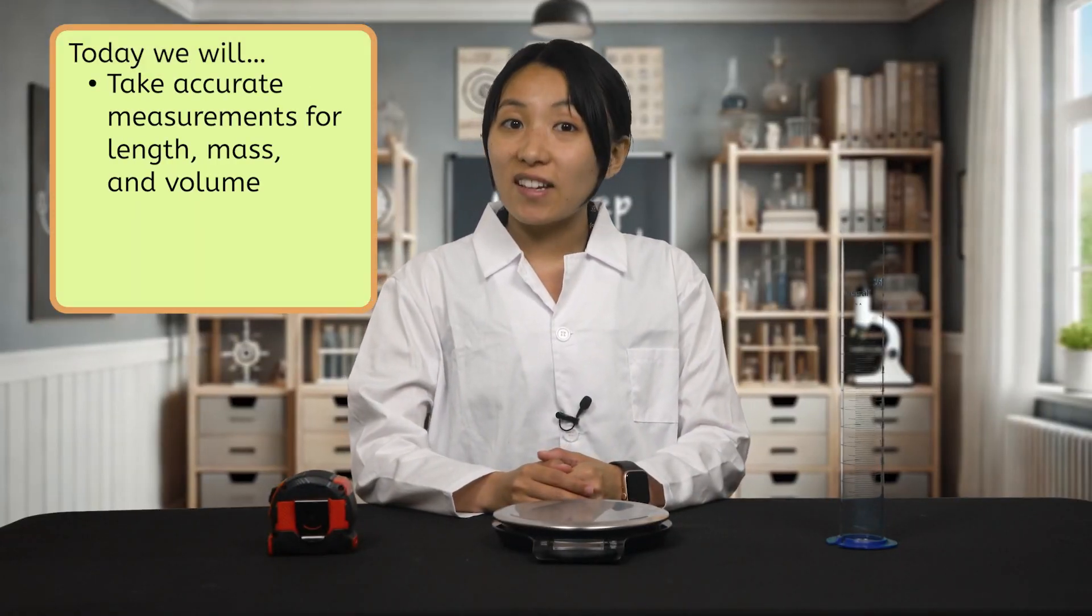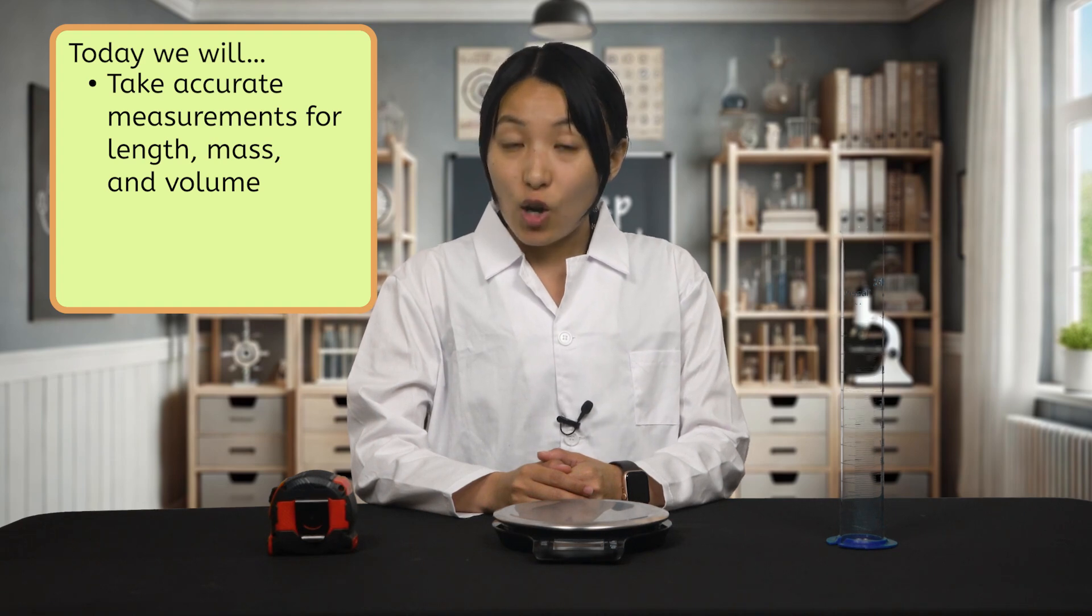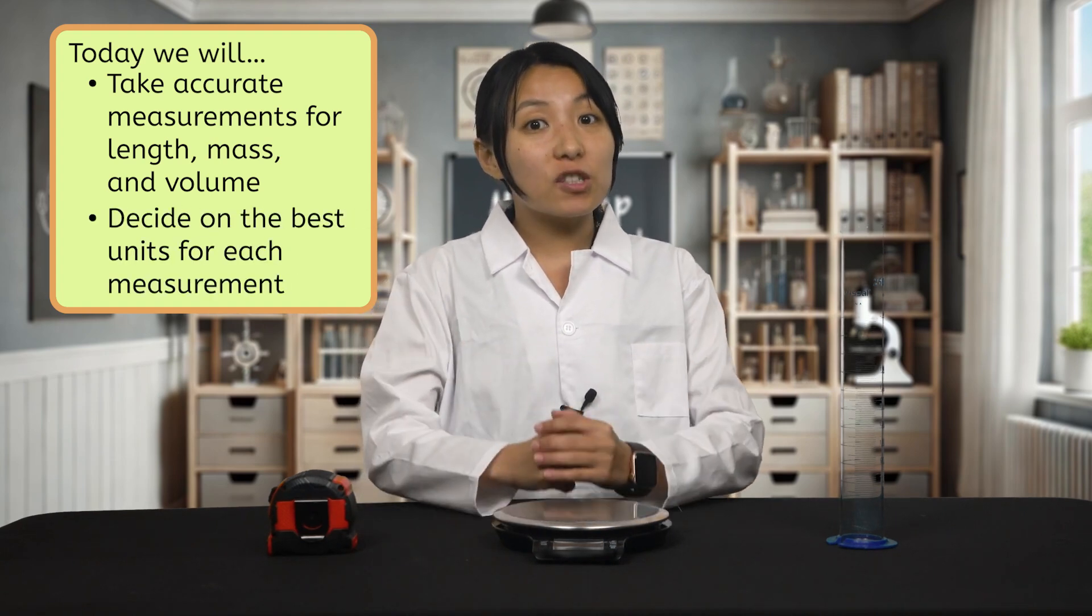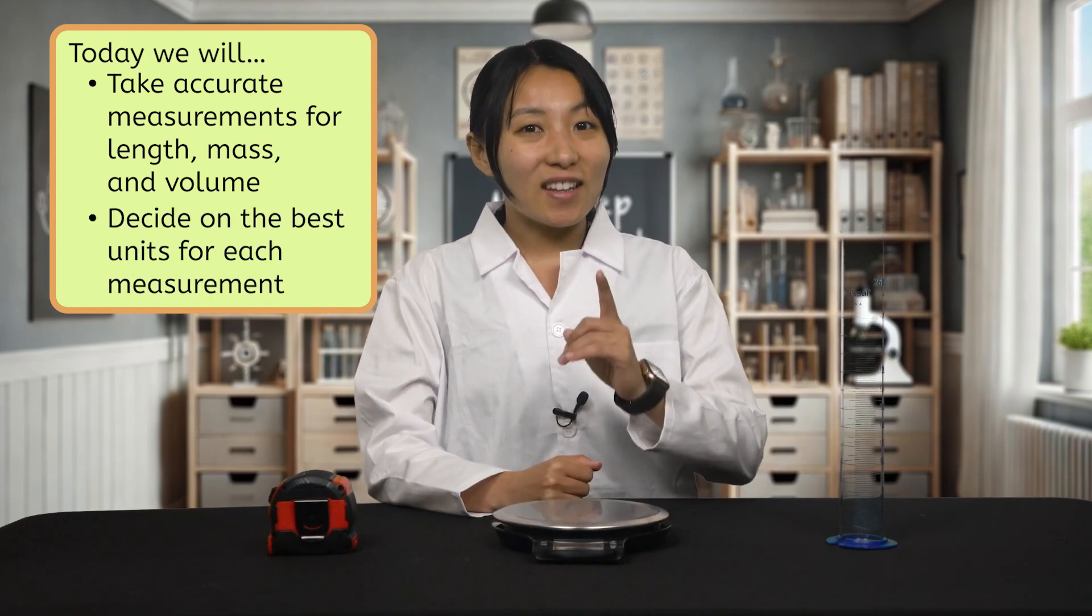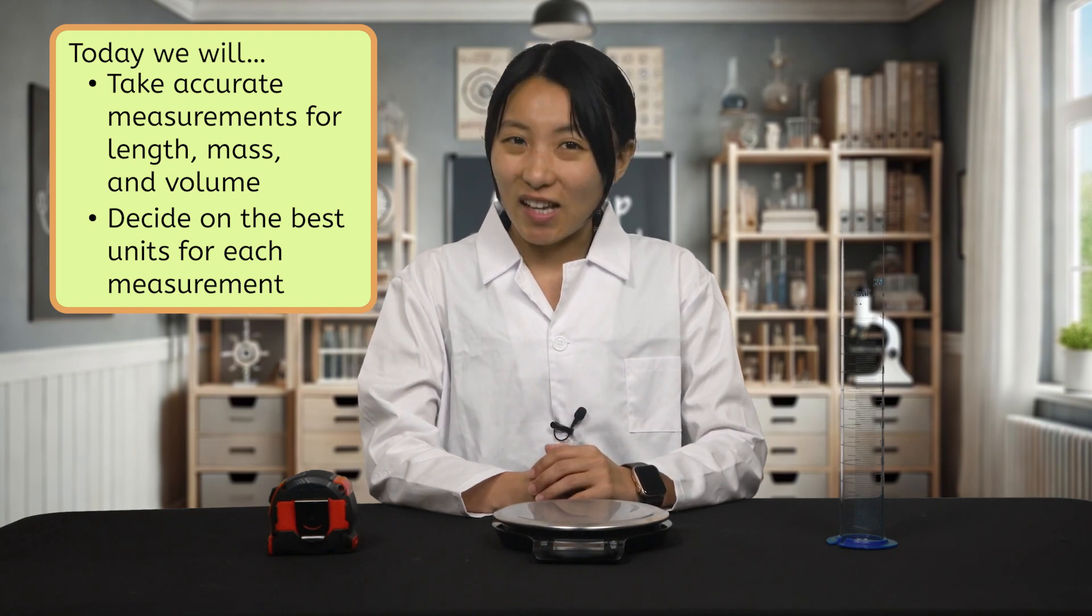Awesome. Today we'll take accurate measurements for length, mass, and volume. We'll also decide on the best unit to use for our measurements so we can easily communicate our data with other scientists.